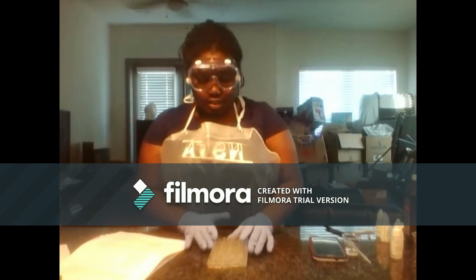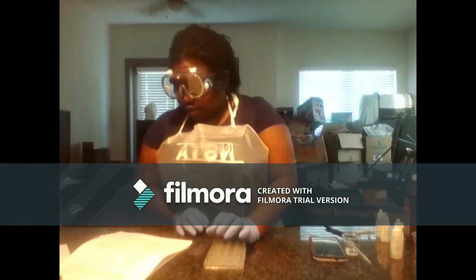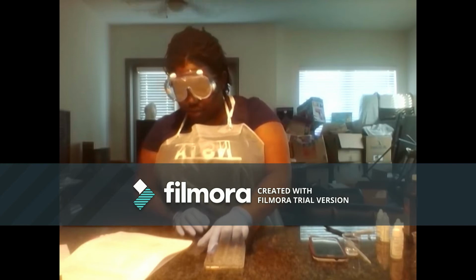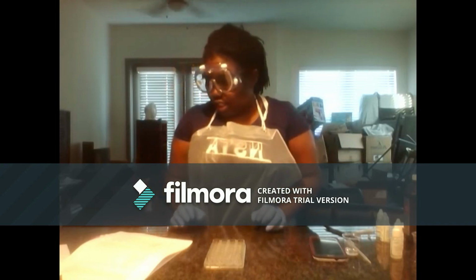Alright, so I've gone ahead and prepared for the concentration effects of hydrogen peroxide. And I've filled up 8 well plates. For trials 1 and 2, I have 8 drops of potassium iodide, 2 drops of hydrochloric acid, 4 drops of starch, no water, 8 drops of sodium thiosulfate, and I'm holding on to the hydrogen peroxide so that I don't start my experiment in advance.